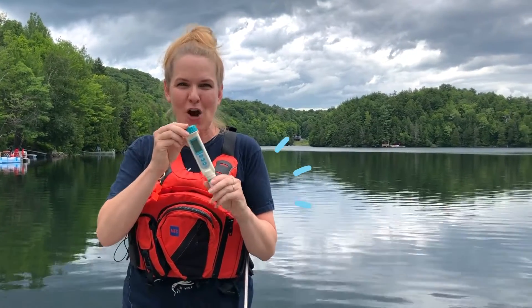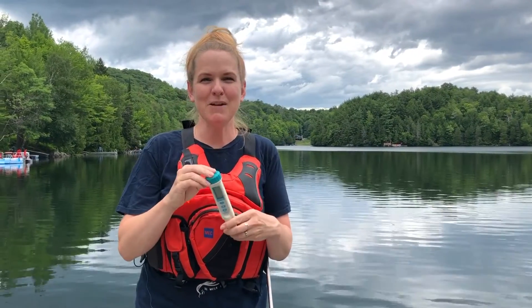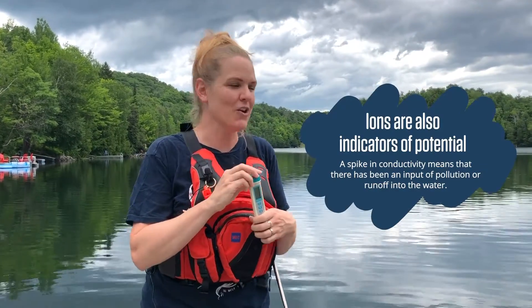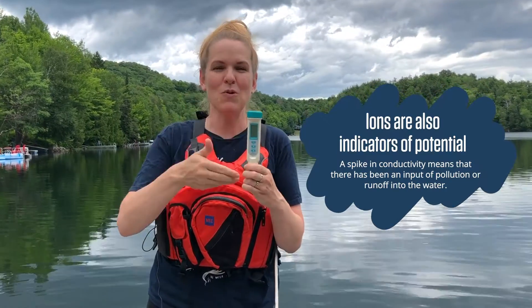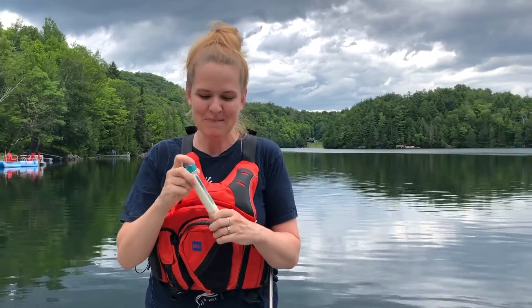In this video I'm going to be showing you how to use this conductivity meter. A conductivity meter is a measure of ions — minerals, metals, and salts in water that can conduct electricity — and these will increase the value of conductivity.